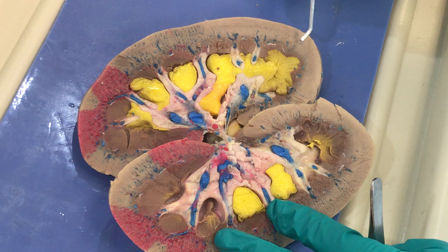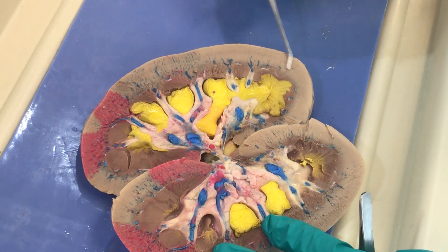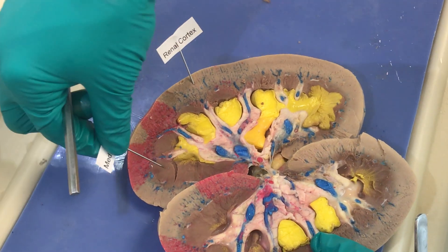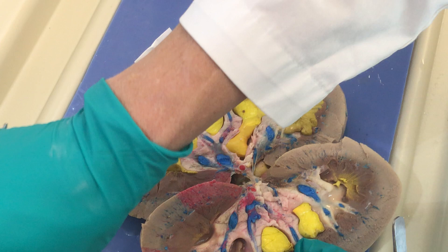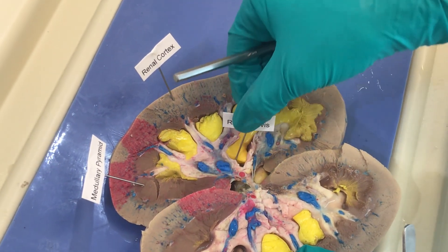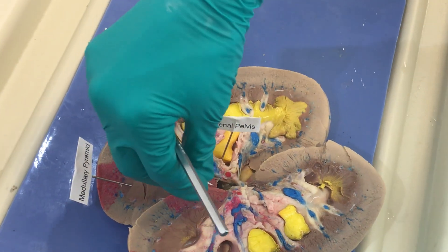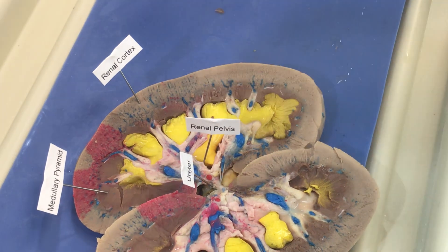For the kidney dissection, those are the main points we want you to know. This is our renal cortex — I'll put a little label there. These are our medullary pyramids — here's a very nice one you can see here. And then of course the renal pelvis, which is this big space where urine is collecting and will leave through the ureter. Remember, that's also where your renal artery and vein are entering.